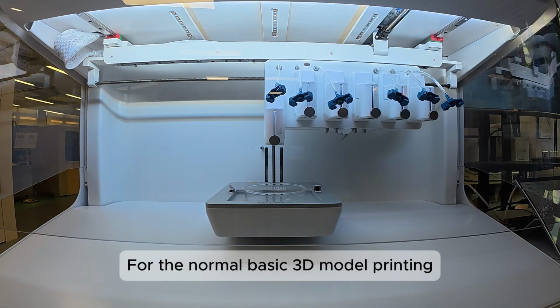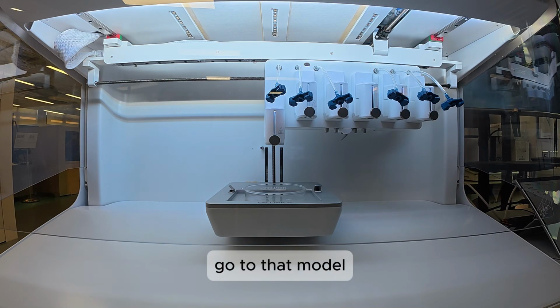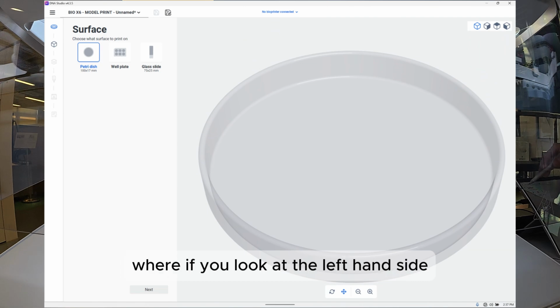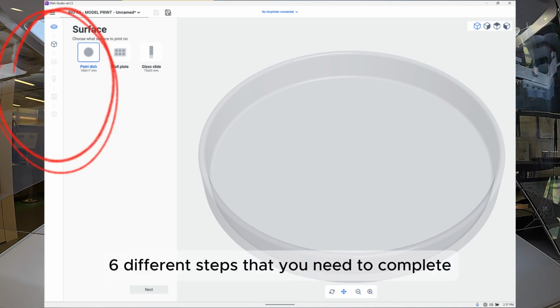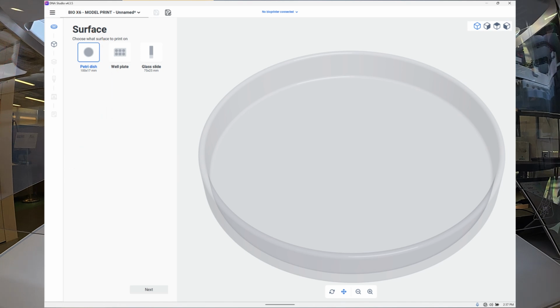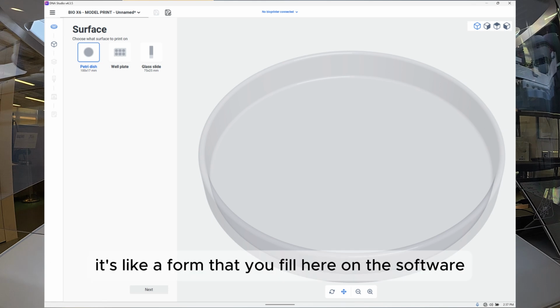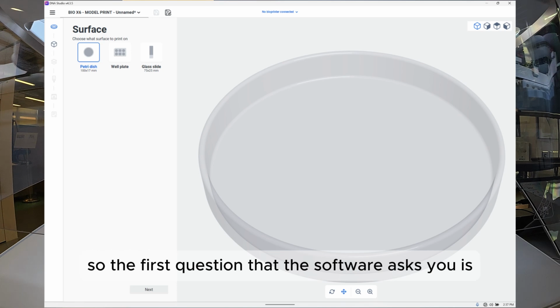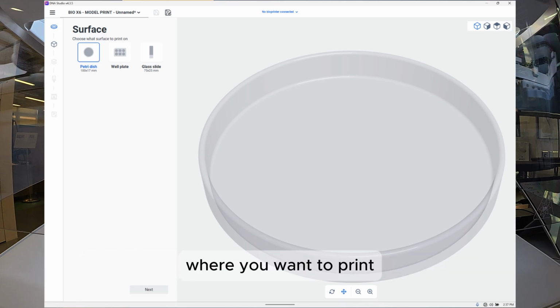So for normal basic 3D model printing, go to that model and it will bring you to this screen, where on the left-hand side you can see 6 different steps that you need to complete, like a form that you fill in on the software, and then the printer will start printing. The first question the software asks you is where you want to print.